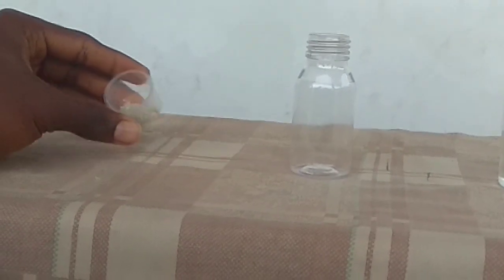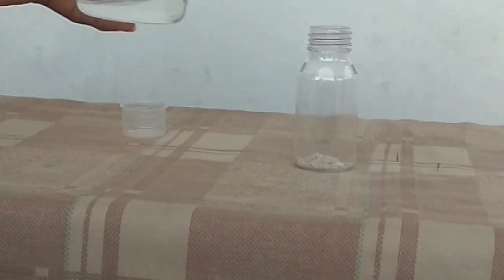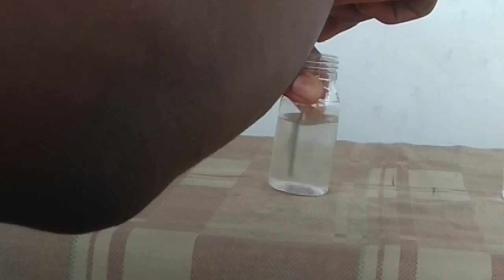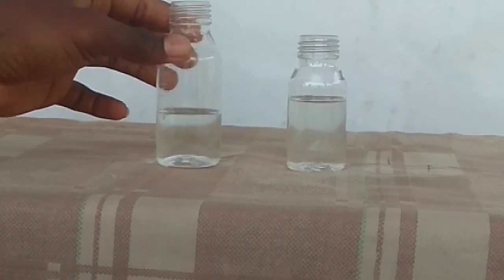I'm going to feature this reaction in today's video. Here I have one gram of sodium sulfate, and to it I'm going to add 50 cm³ of water. I'm going to stir this so I can have a homogeneous mixture. Okay, that's it. I have 45 cm³ of sulfuric acid.